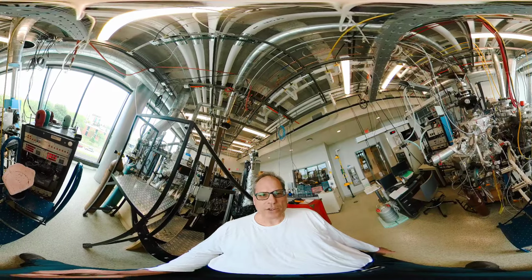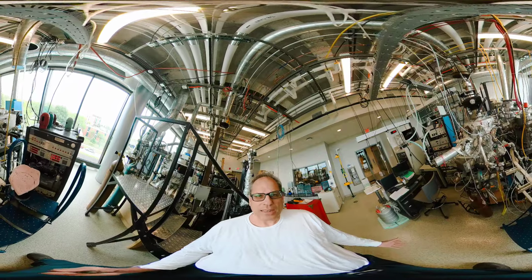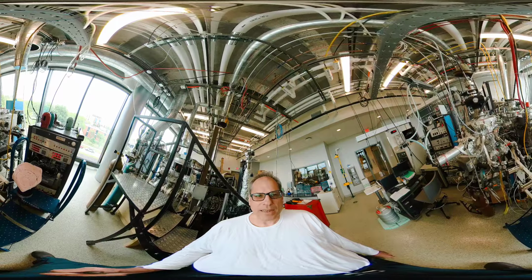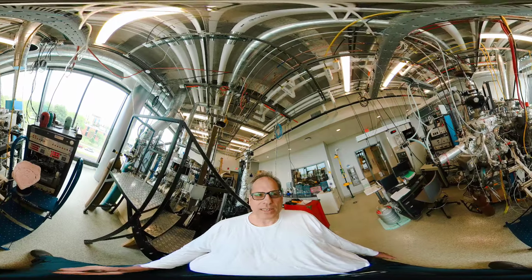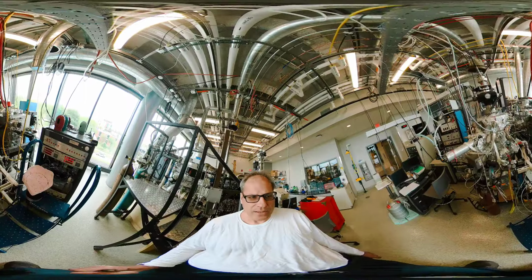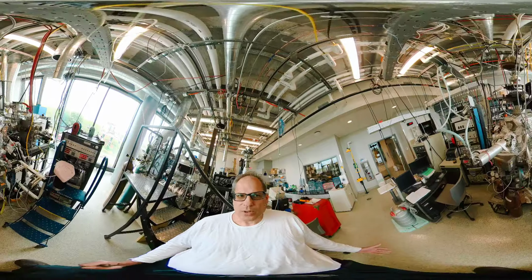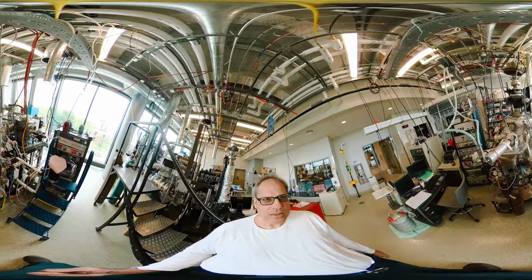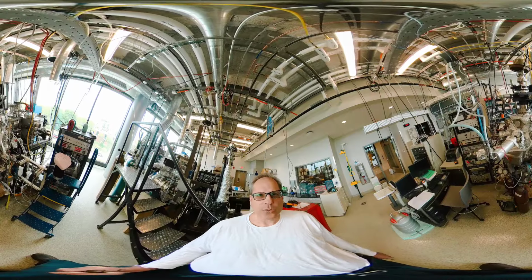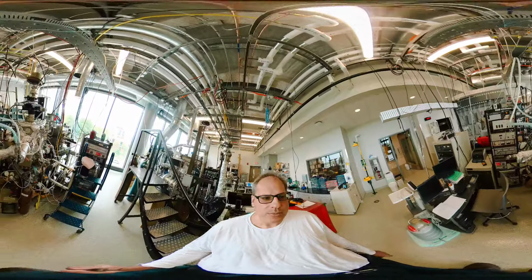These are 3 connected chambers, and we have an adiabatic gas expansion. Adiabatic means that the gas is cooling down. You might remember that from a PChem class. And that way we can generate a quasi-monochromatic beam of particles. And we look then at the scattering of CO or CO2 or something like that on the surface of the catalyst. So we are characterizing catalytic processes on surfaces which are mounted in the vacuum chamber.